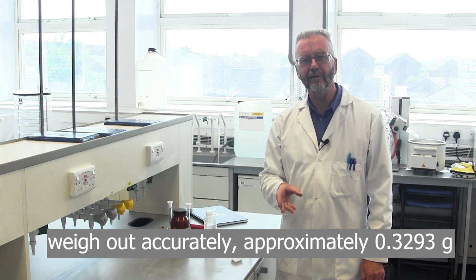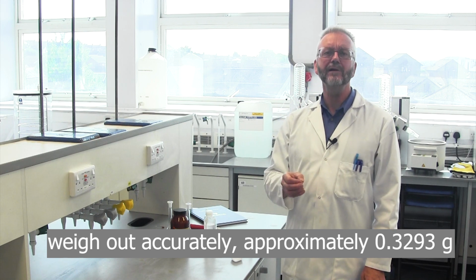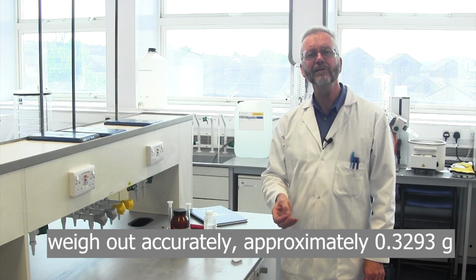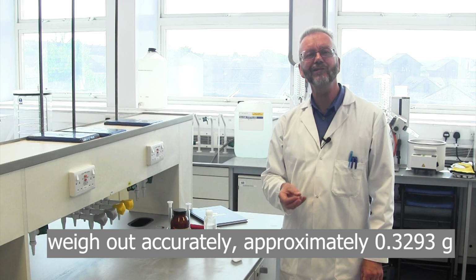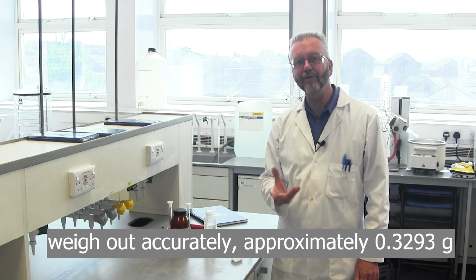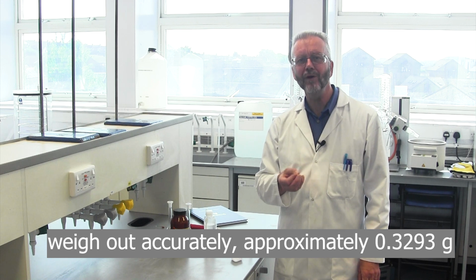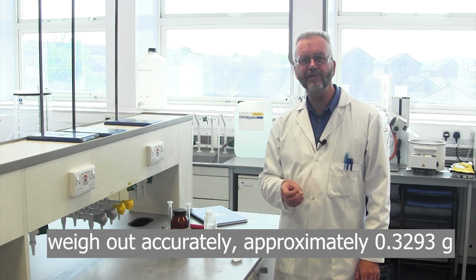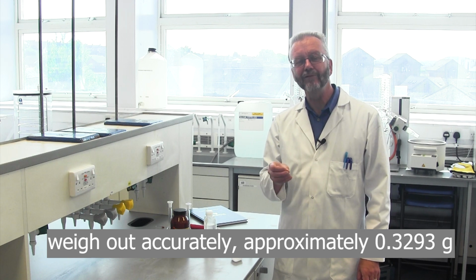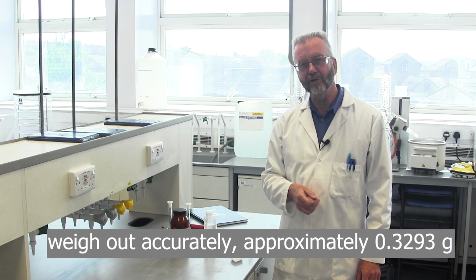Weigh out accurately, approximately 0.3293 grams. The important point here is that we need to know the concentration accurately, not that the concentration happens to be a round number. The calculations before we got to the lab give us a mass to aim for, to get the concentration at the right level. We'll use the actual mass to calculate the final concentration.